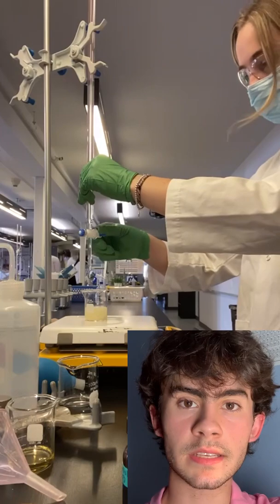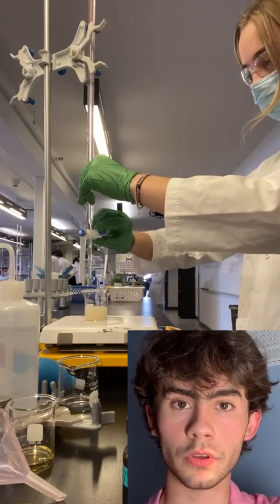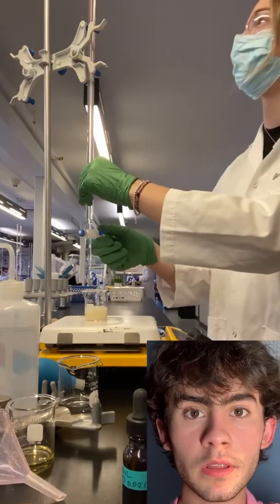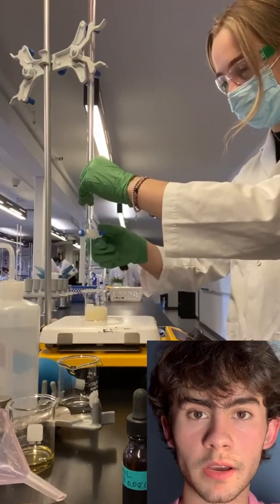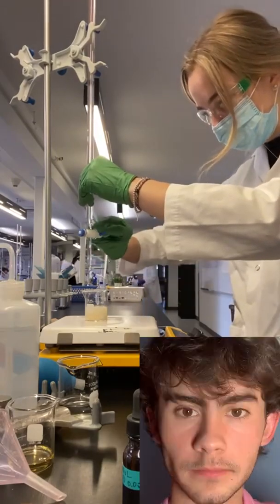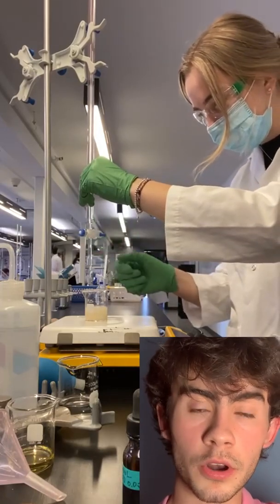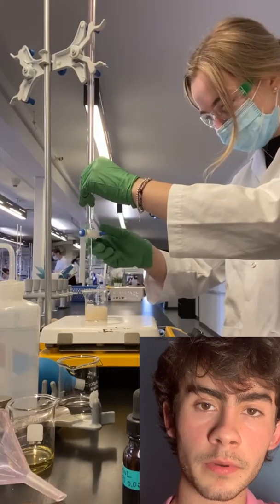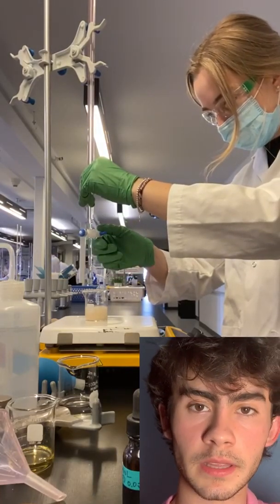First, Emma needed to assemble the titration montage and go collect about 5 milliliters of used vegetable oil in a beaker. She then filled a 50 milliliter burette with a 0.1% mass volume concentration of potassium hydroxide. She then removed the air bubbles inside it by gently tapping on it. She then washed a 20 milliliter volumetric pipette using first distilled water and then using isopropanol. She then filled 20 milliliters of isopropanol into the volumetric pipette and then poured it into the 50 milliliter beaker.